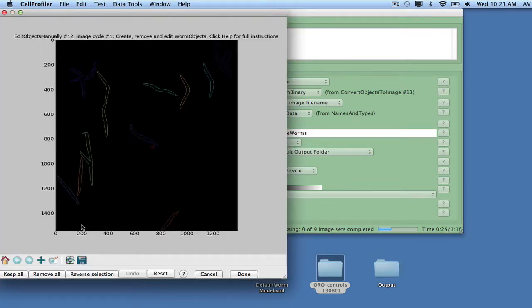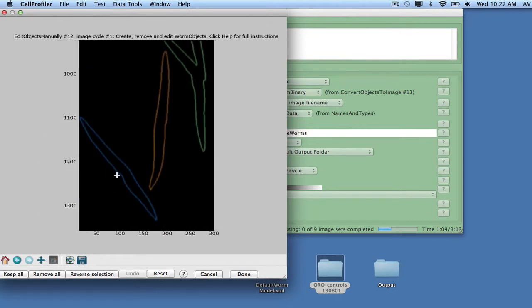Once the pipeline reaches Edit Objects Manually for the first image in the cycle, an editing window will appear. Here, the goal is to use this interface to select all single isolated worms that do not touch a neighboring worm and do not touch the image edge. This is done by clicking on each single worm. Once a worm has been clicked, its outline becomes dashed. The zooming and panning tools can be used to better see the outlines of the individual worms for selection.